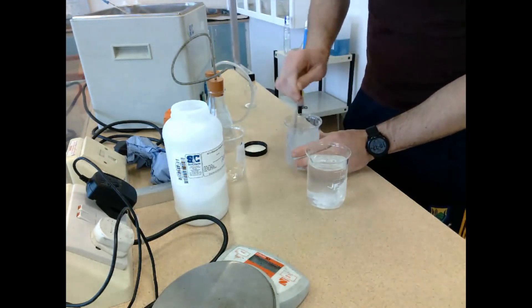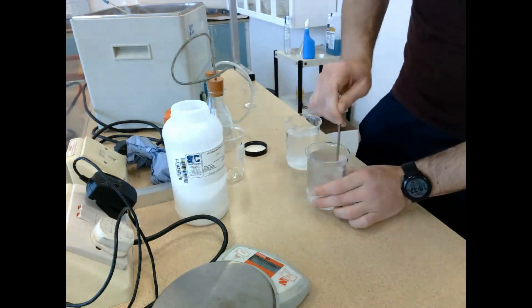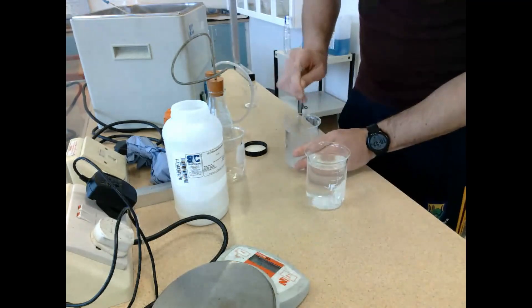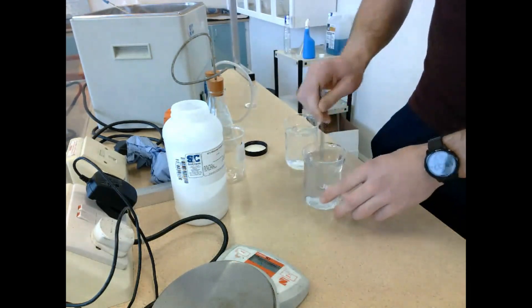Then we'll do the exact same thing and add it to the second beaker. This glucose is going to act as the source of energy for the yeast during this experiment. As you can see, we just stir that up to ensure that the glucose is well dissolved.